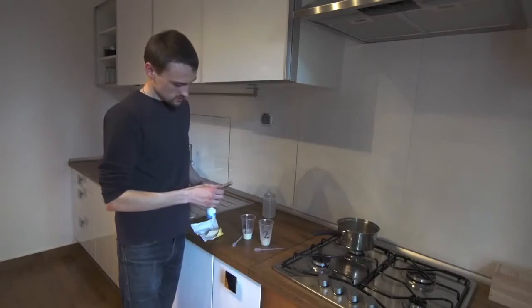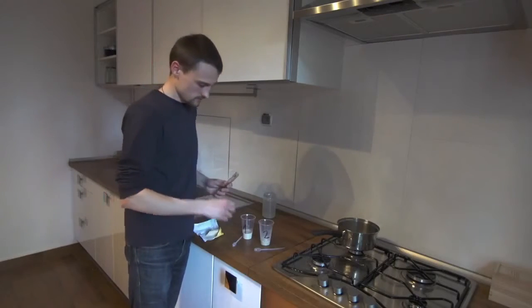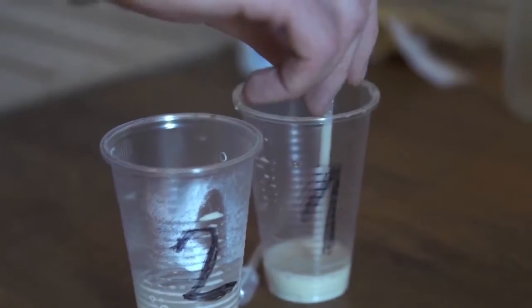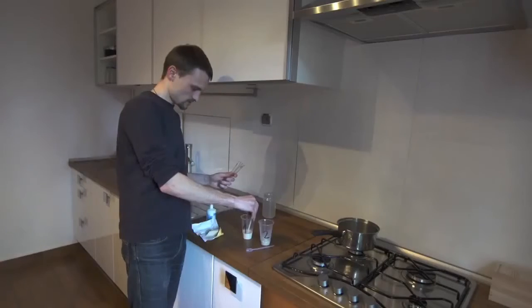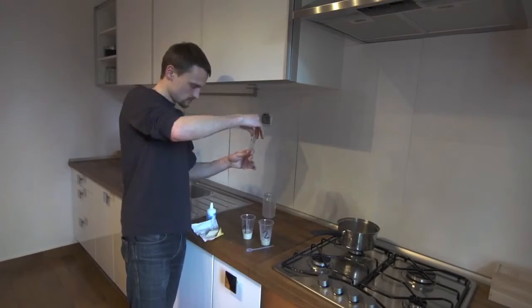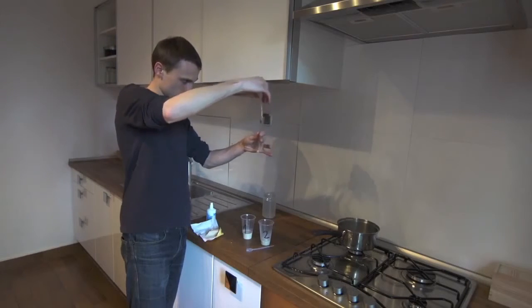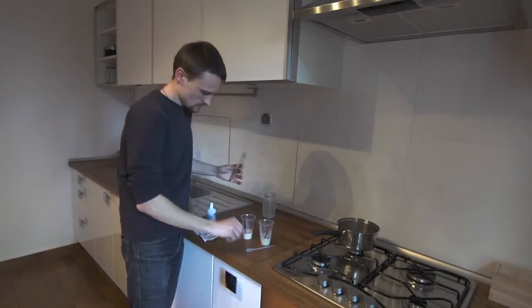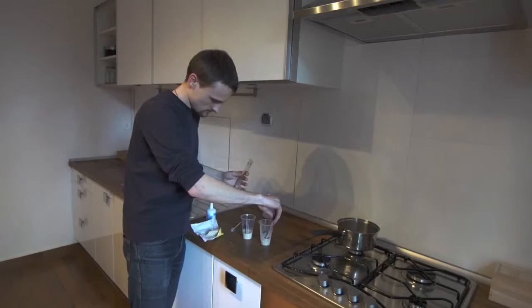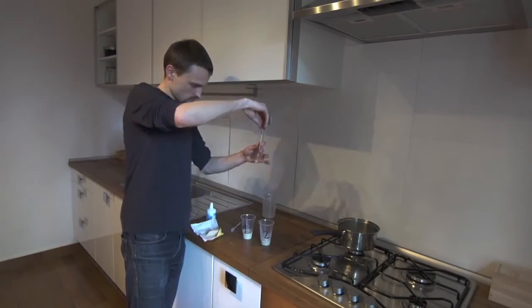Next, we introduce mixture number 2 into test tube number 2 and mixture number 1 into test tube number 1 using a pipette. We use equal amounts in both cases — for example, 3 milliliters. Now I'm pipetting mixture number 2 with the second pipette.